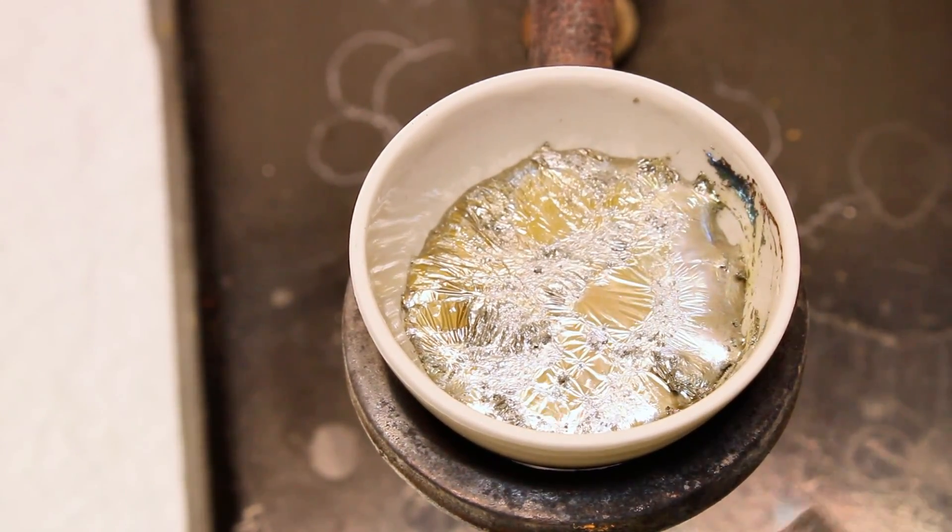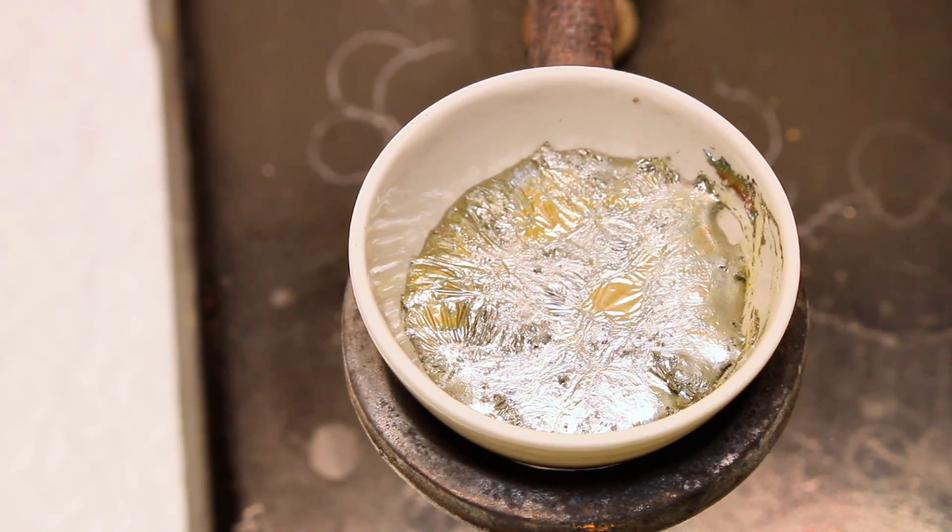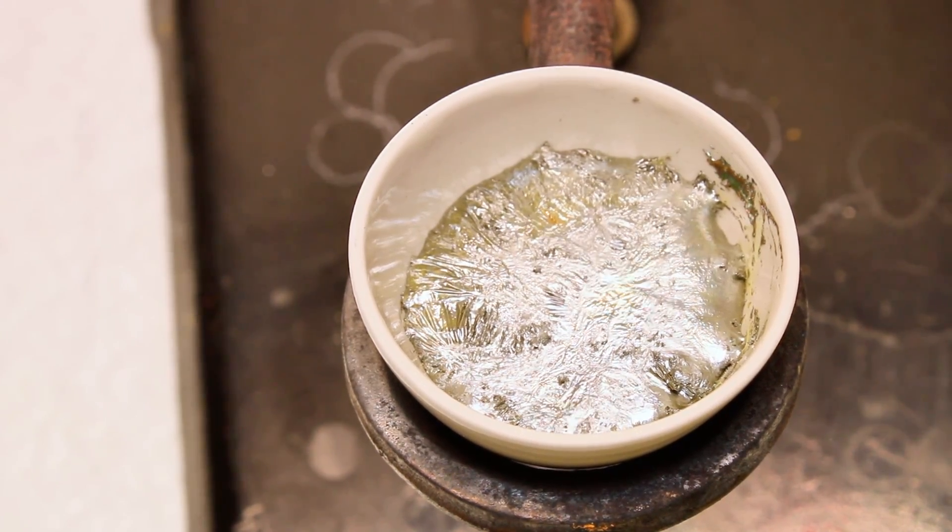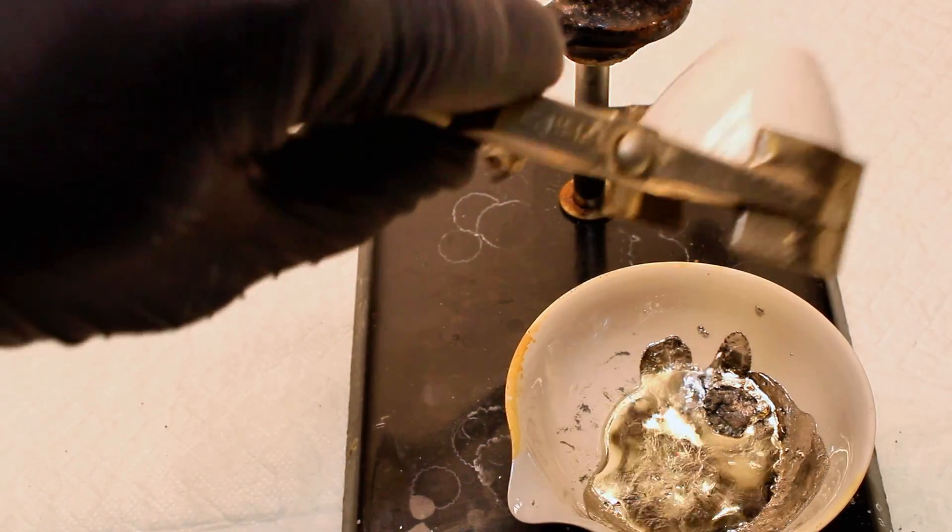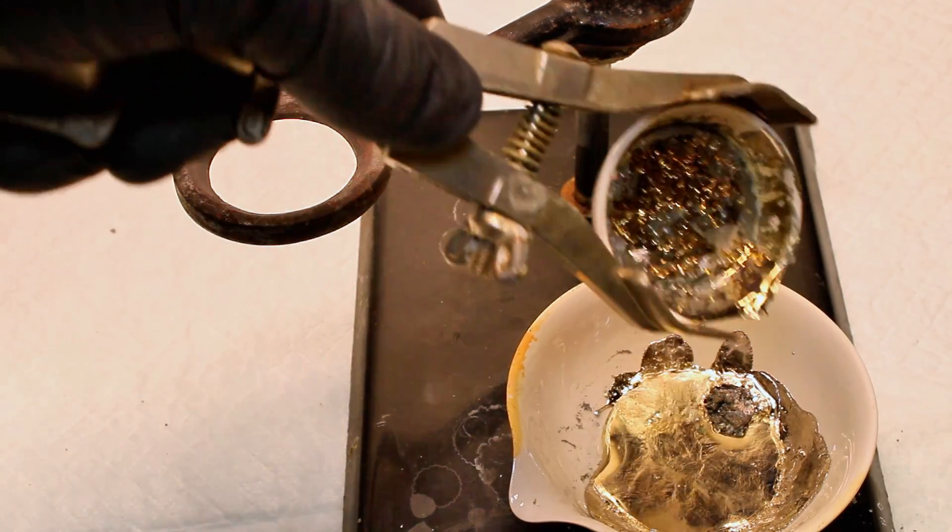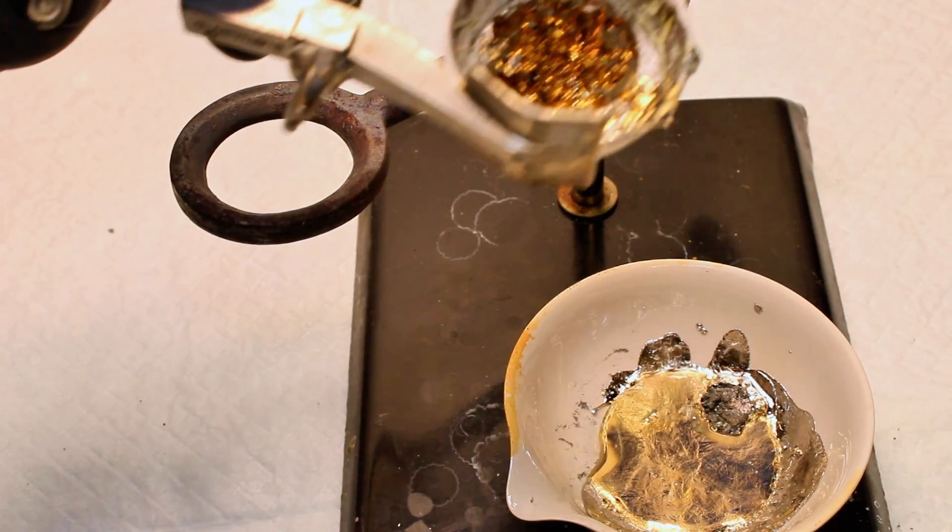Regardless, when I felt like I had some good crystals form, I went ahead and poured off my excess bismuth, and this left behind some beautiful bismuth crystals, which were initially golden yellow. This color quickly changed to red, and then a bluish purple, which was really cool to see in person. I might try and grow more bismuth crystals in the future, but I certainly won't be getting that bismuth from Pepto-Bismol.